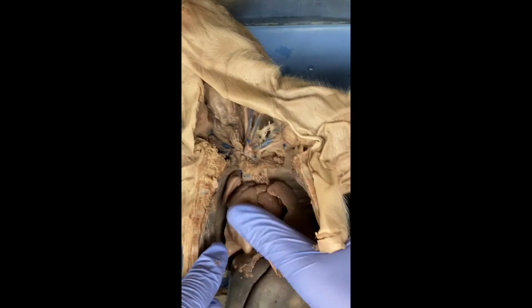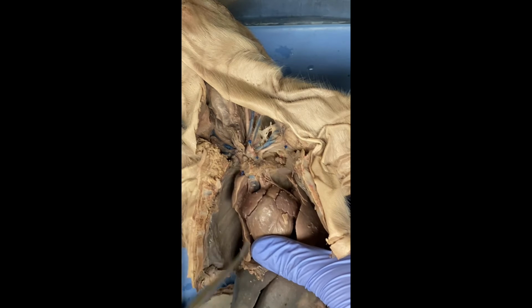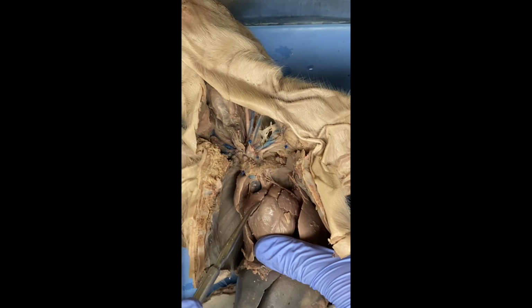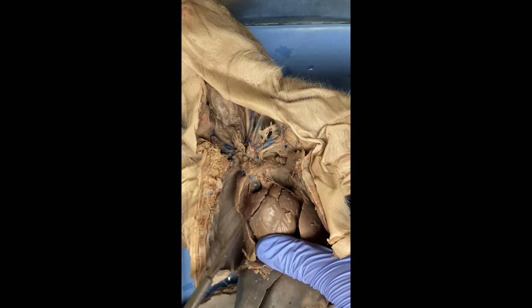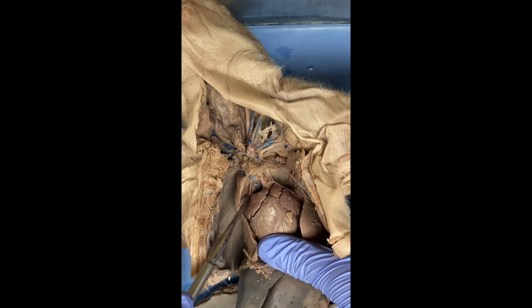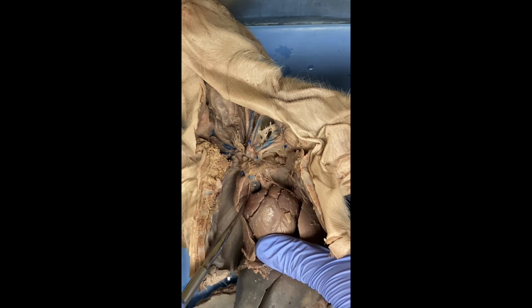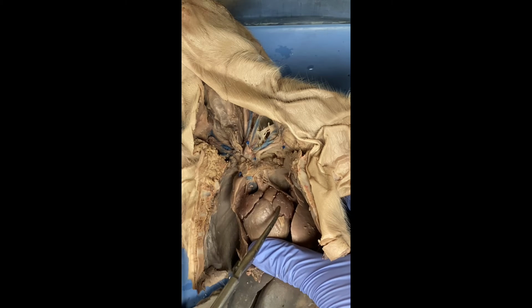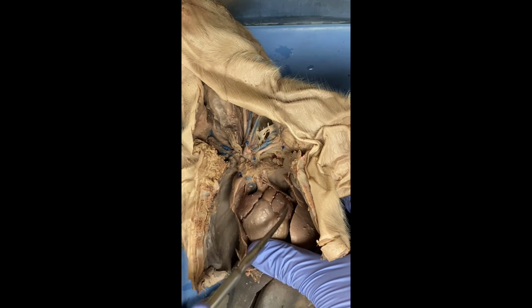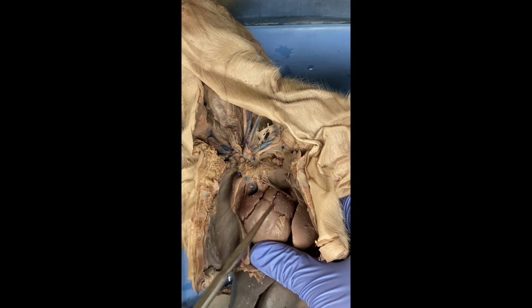So, moving forward, we have the right atrium, which is right here. This is the right atrium. And it takes deoxygenated blood and pushes it into the left ventricle. Or, wait, sorry, the right ventricle. My apologies. The left atrium, on the other hand, takes oxygenated blood and pumps it into the left ventricle. So this goes here, this goes here.